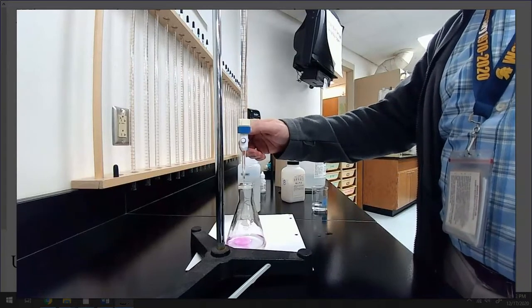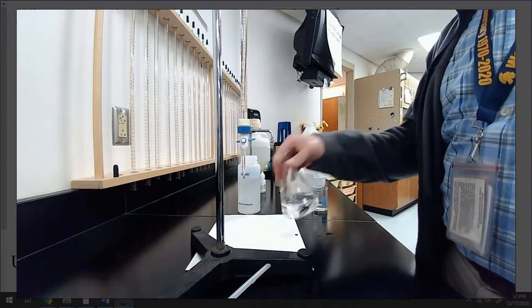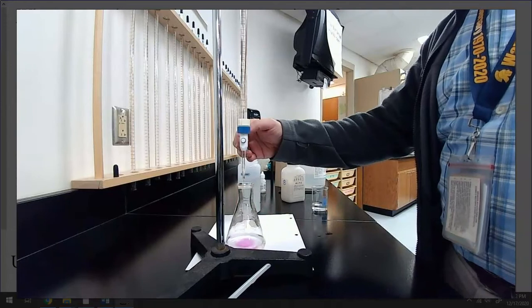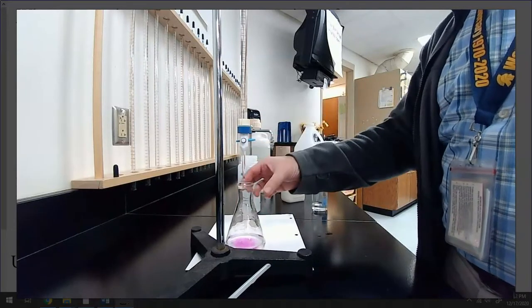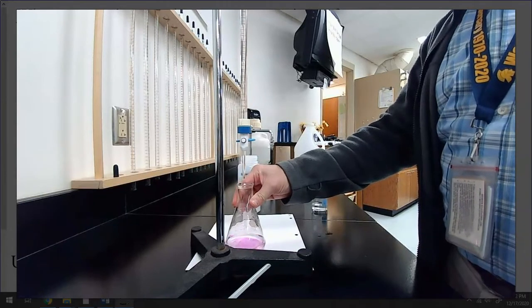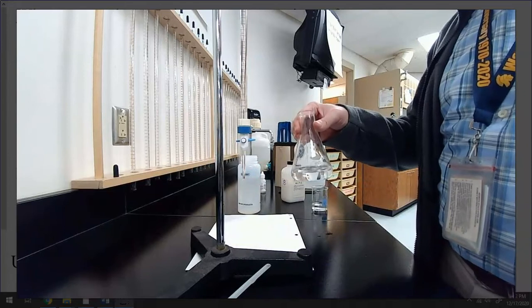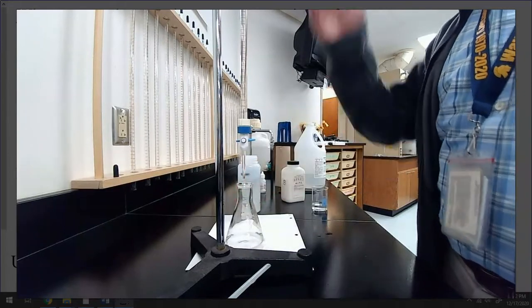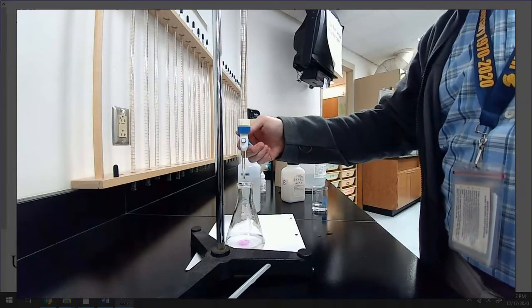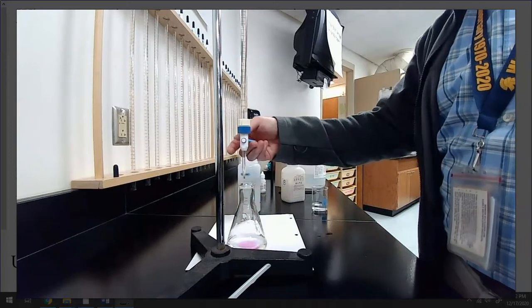You can see pink. Okay, let's be a little careful here. When I swirl it, it goes away. Okay, it's not mixed, right? So if you can see the pink on the screen, I hope you can. I think you can. Yeah, you definitely can. All right. It's looking like it's trying to be done, but when I mix it up, it goes away, right? So once we do one trial, the second trial will be much quicker. I'll try to be good either way and make sure that we're not overshooting it this first time. Let's see how fast I can do this without screwing it up.